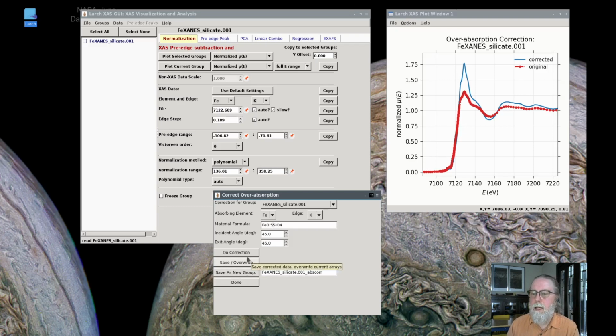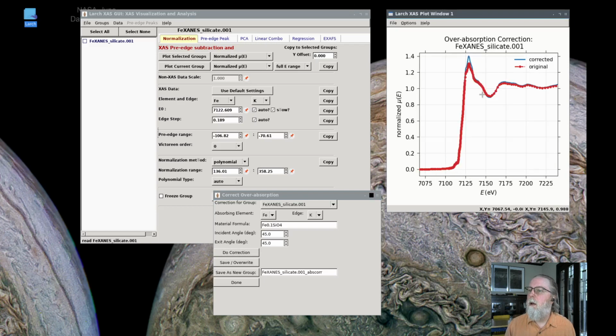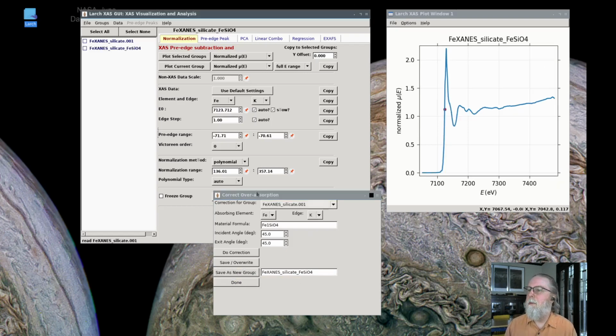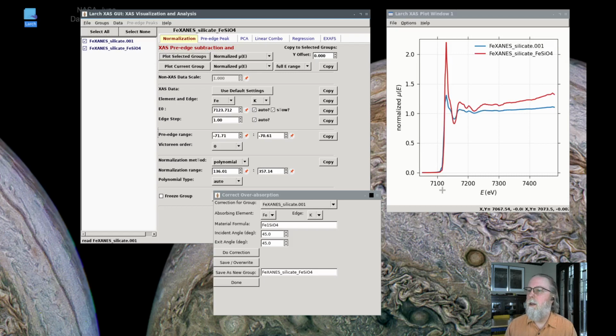The FLUO algorithm. And again, we can do the correction, we can play with the stoichiometry. If the stoichiometry was really low, if I said that was 10% iron, the correction is very small. And if I say that it's stoichiometry of 1, it's bigger, as the iron, the absorbing element, becomes more of the mass of the sample. The correction becomes larger. So if I say this, and I'll save that as iron silicate, FeSiO4. That's not actually the right stoichiometry for this data set, but it's close enough for this application. And again, those are the two.